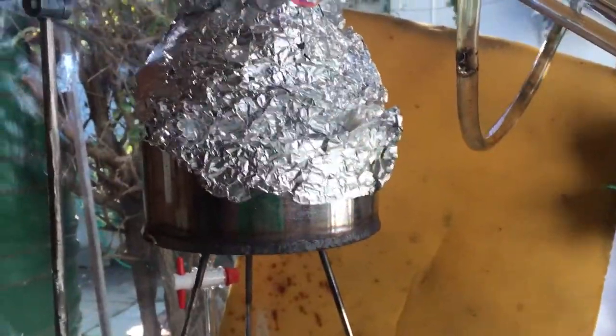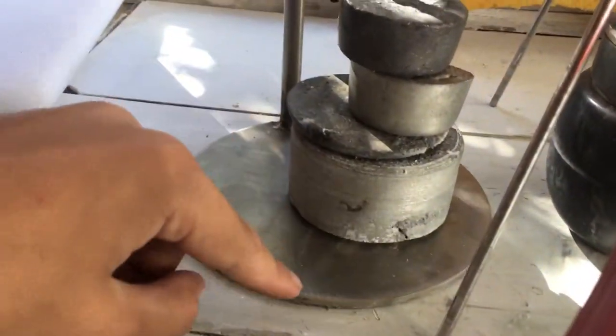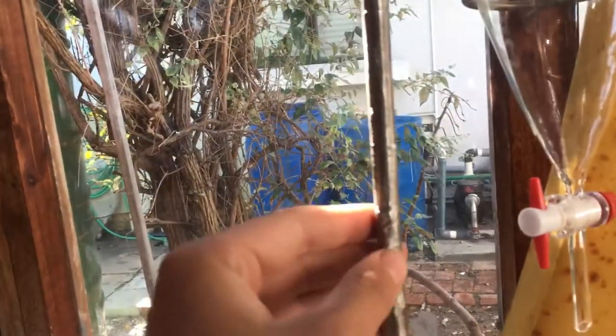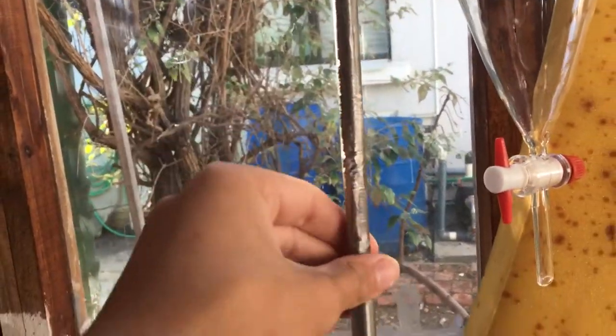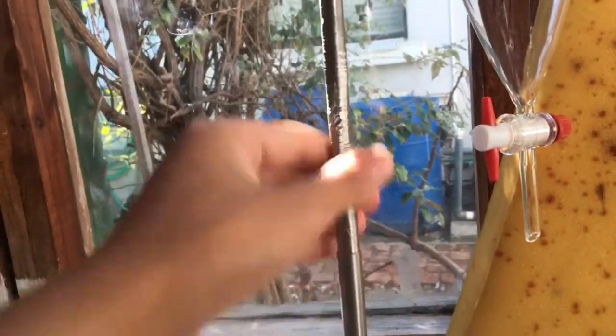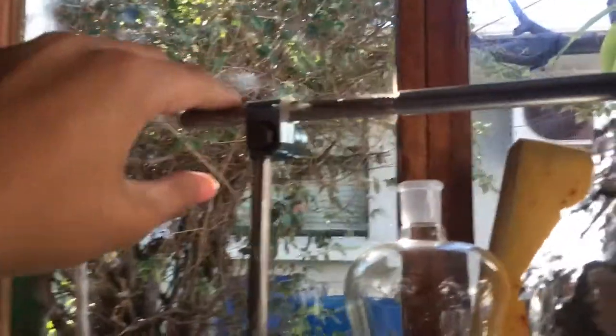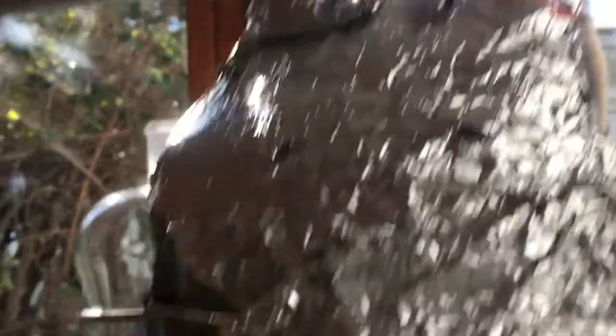If I called it alcohol instead of ethanol, sorry — you just get mixed up by the term. I just want to show this off: my dad made this for me. It's a thick stainless metal plate, stainless rod. He kind of lathed off the top here, but these scratch marks — he thought it was the lathe's fault; it's a really crap lathe, it just wobbles. Anyway, I found this adapter and I can put a little pipe fitting here and it clamps it really nicely.